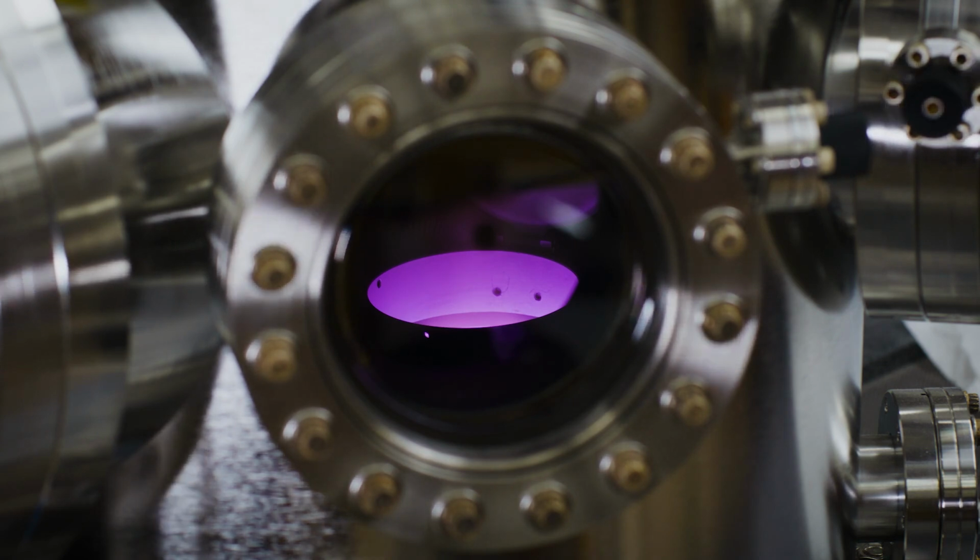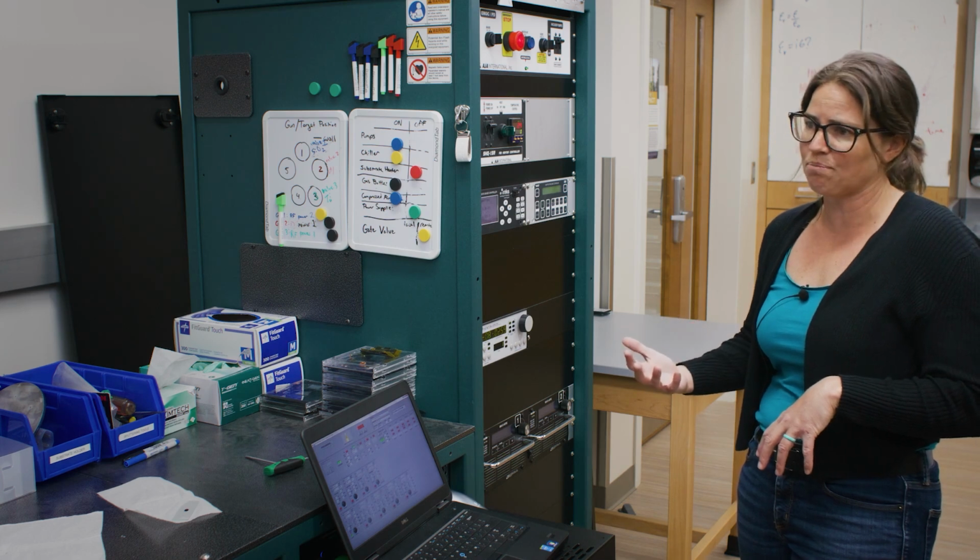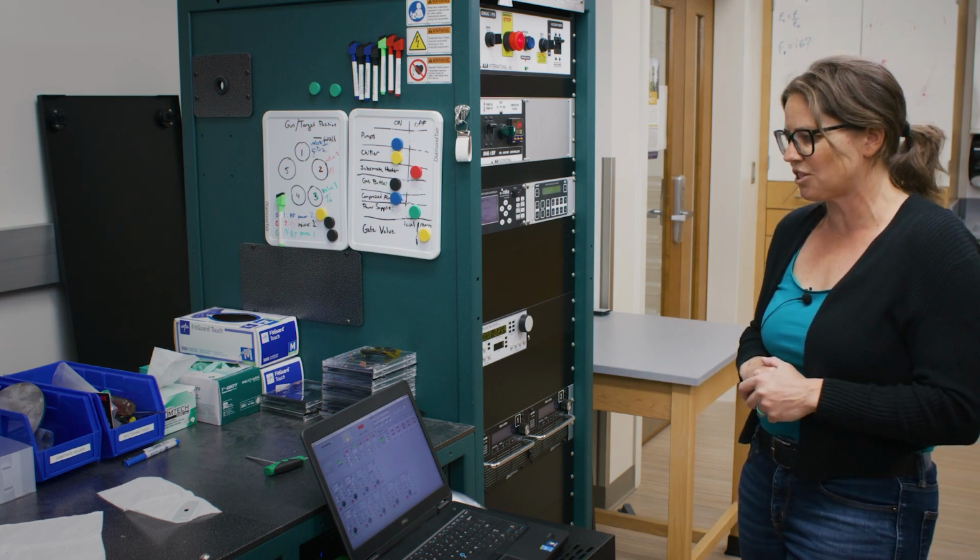And the system starts to ramp up to the appropriate power set point for the deposit, and that's what it's doing right now. So right now we're waiting for our shutter to open, and so we're doing kind of a pre-clean of the source, so that way anything that might have accumulated on top that we didn't want to be there as it sat around and not being used gets kicked off of the source.